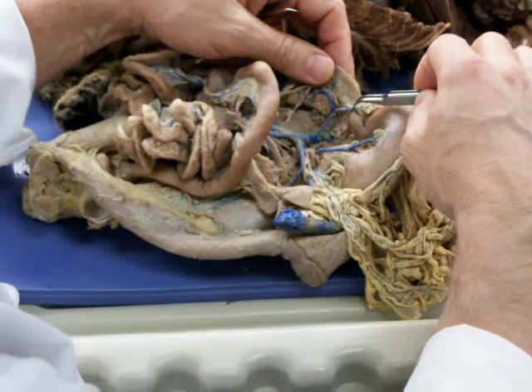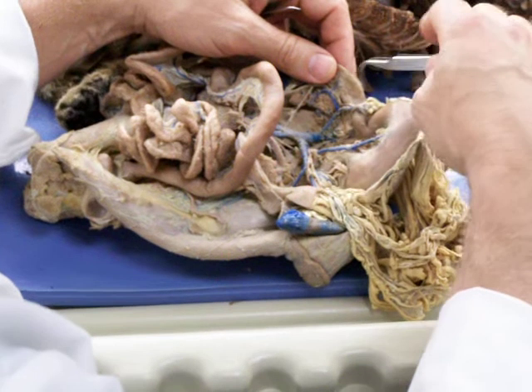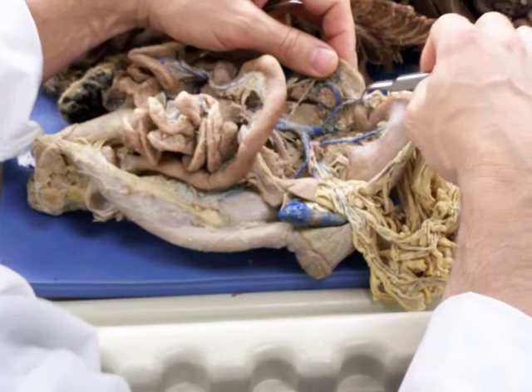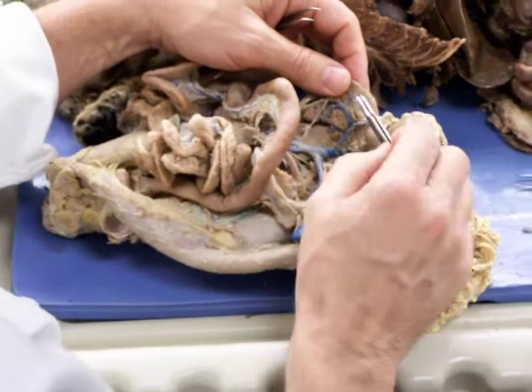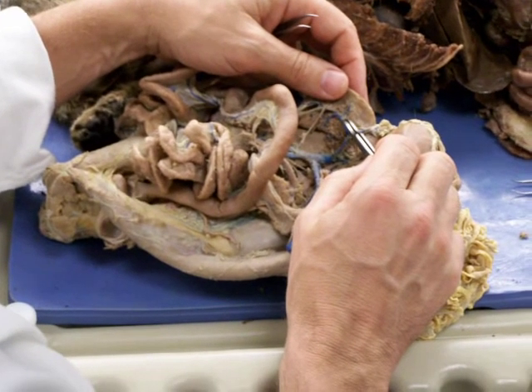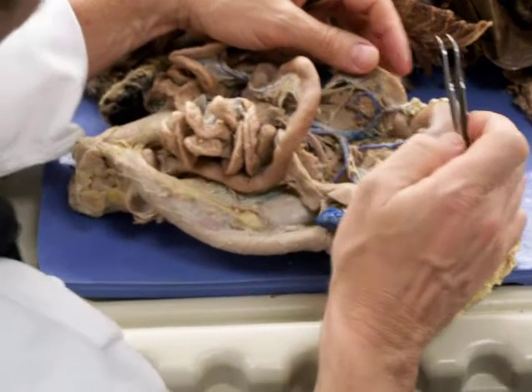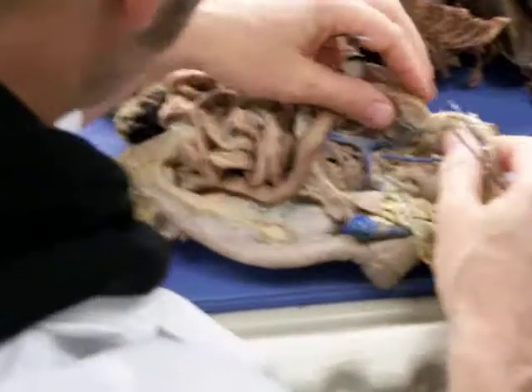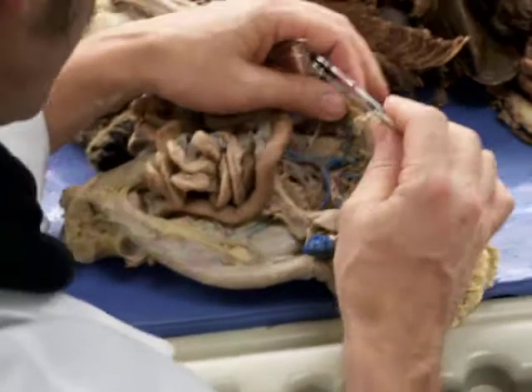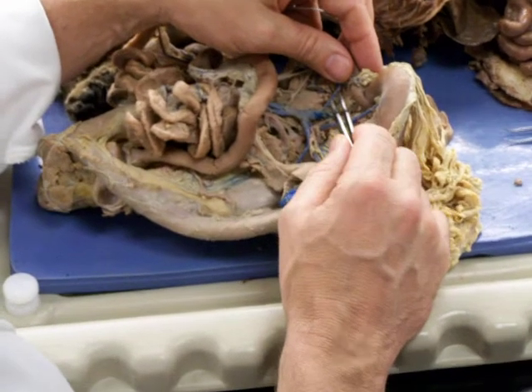It gets a cranial or a right epiploic vein or right gastroepiploic vein that comes from the greater curvature here, and it gets a cranial pancreaticoduodenal vein that runs along with the artery right at the border between the pancreas and the duodenum. There's also a right gastric vein that's been torn off in here, and that's just a little vein that comes into the hepatic portal vein from the lesser curvature right by the pylorus.